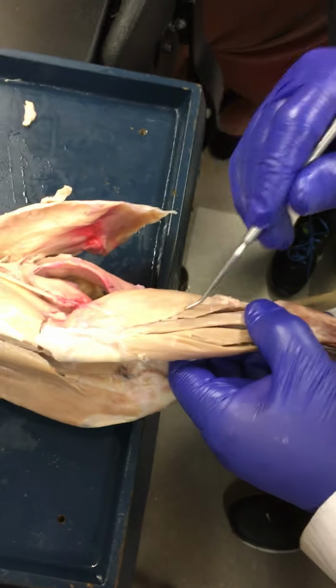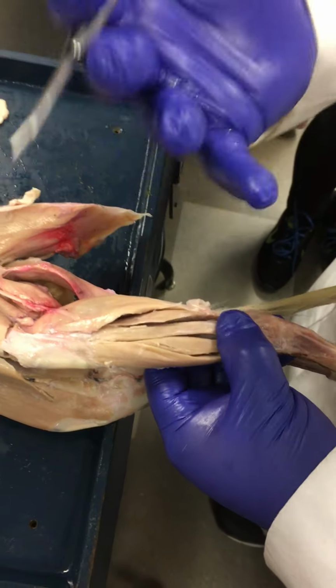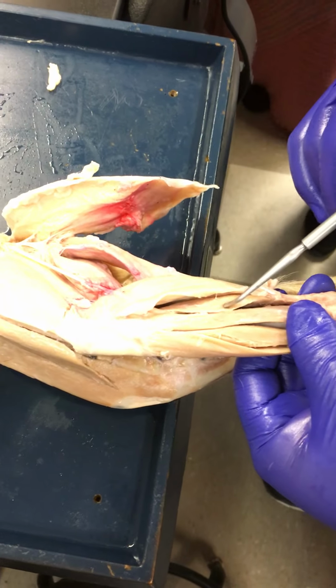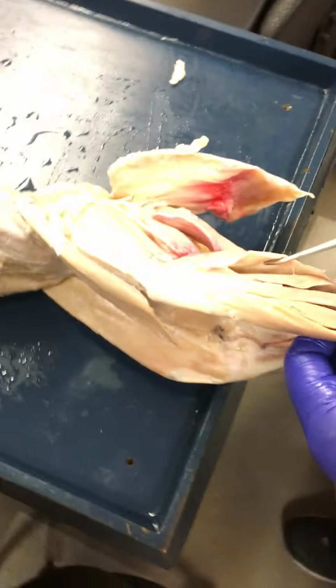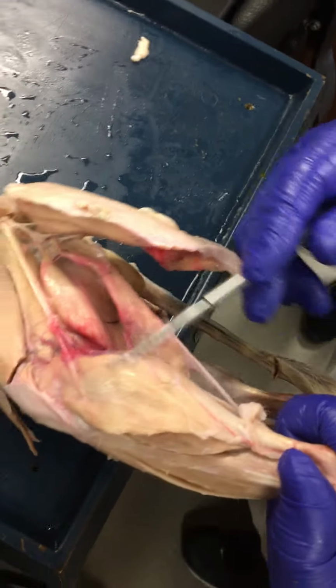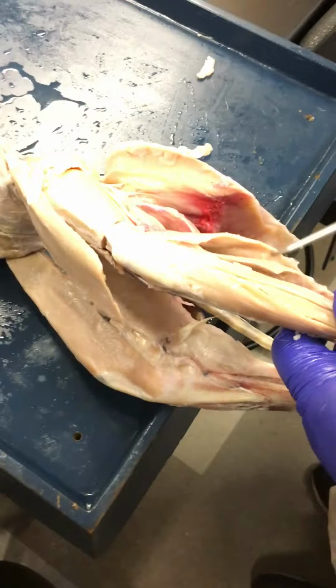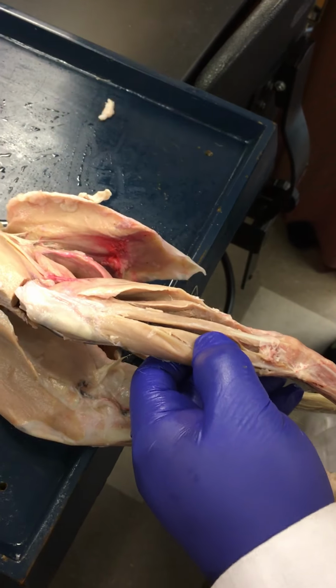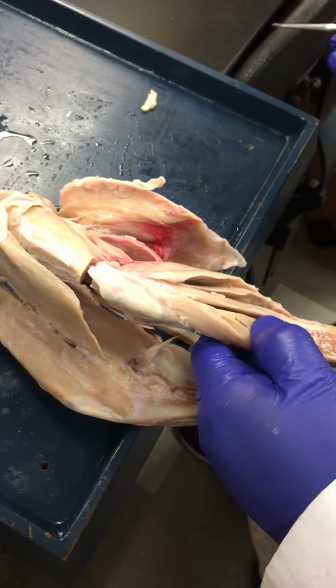And then finally we get to the last two muscles from this kind of lateral posterior aspect. First you see the soleus, and then the gastrocnemius. Right? And the gastrocnemius is that large calf muscle. Both of these are going to plantar flex, so you're going to extend the toes, right, as if you were stepping on the gas pedal.